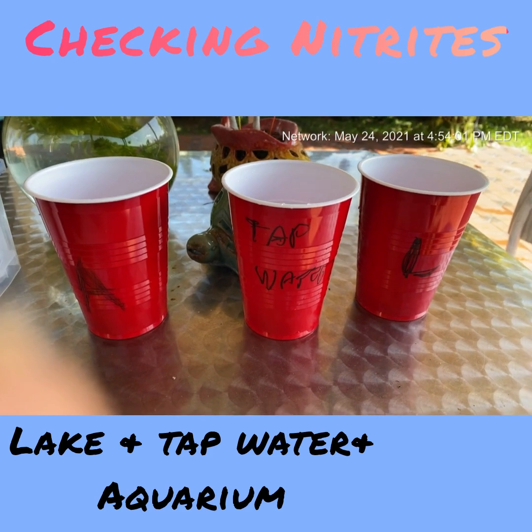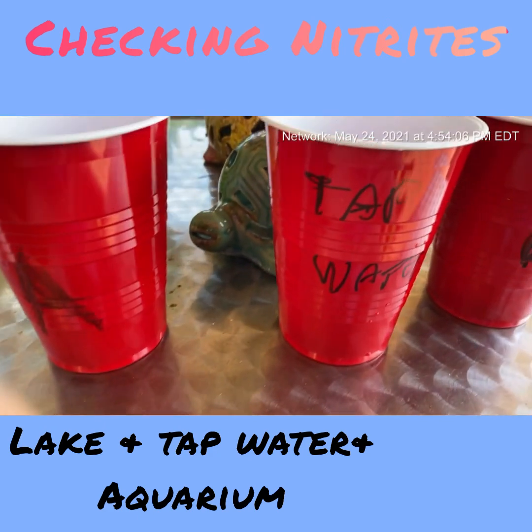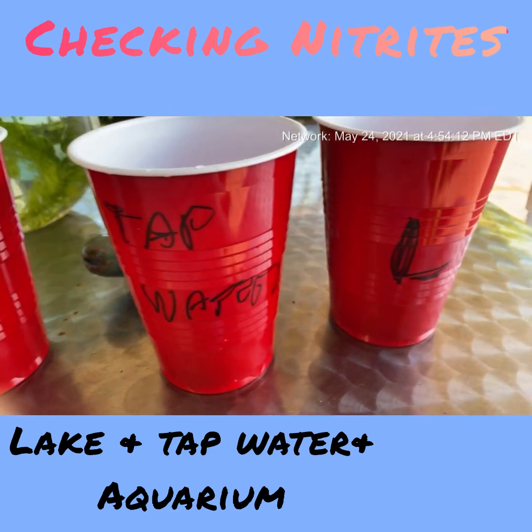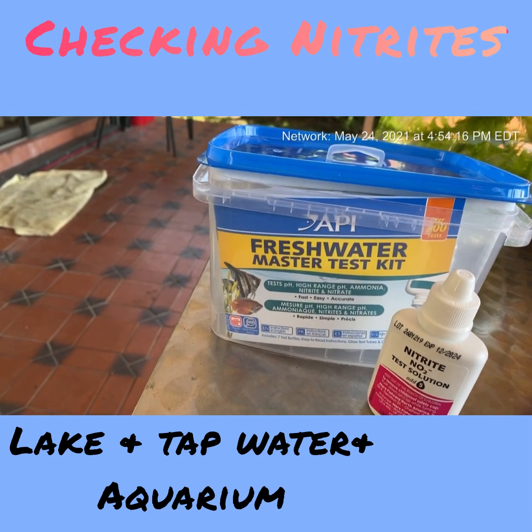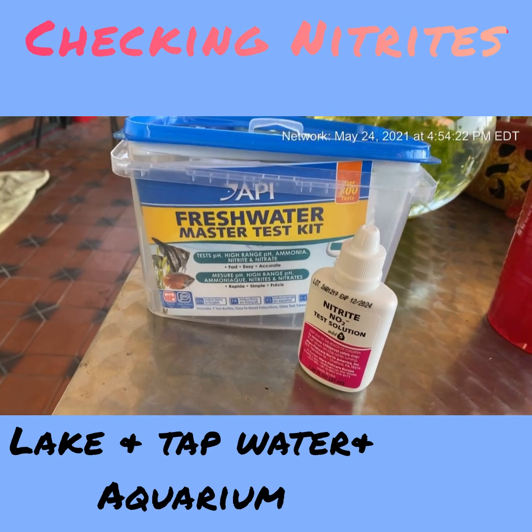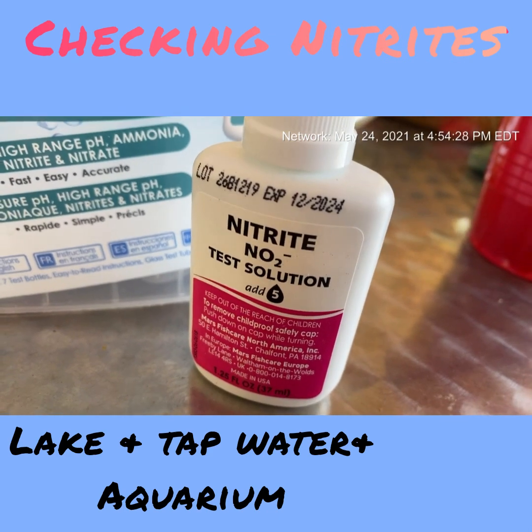Here we are again with the famous solo cups. I've labeled them — aquarium, tap water, and lake water. I have my freshwater test kit. Remember to read the directions. For nitrites, it says: add five drops.